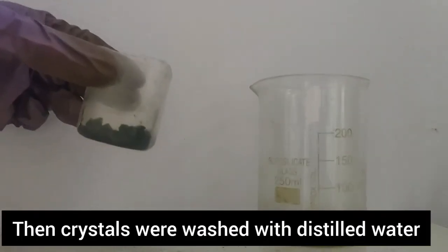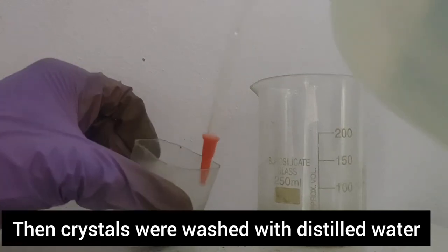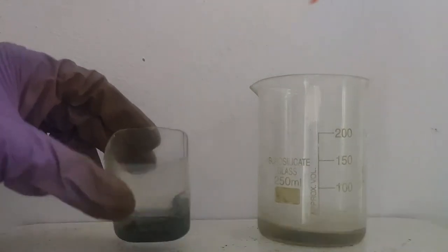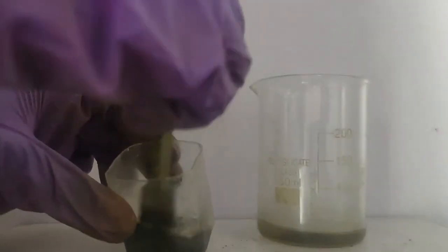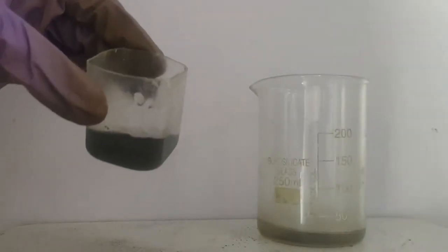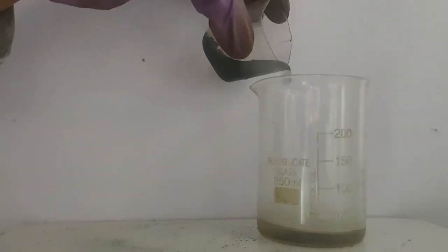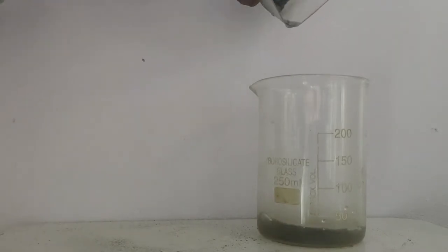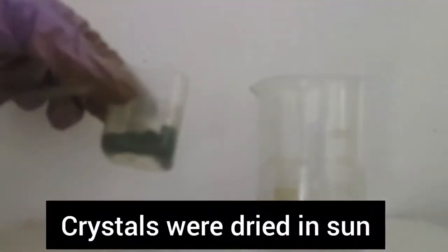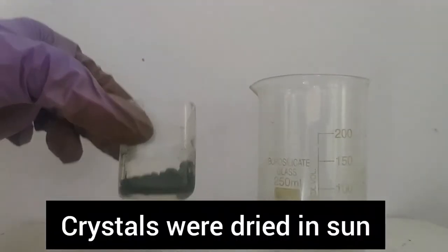The crystals were washed with distilled water. And then the crystals were left in sun to dry.